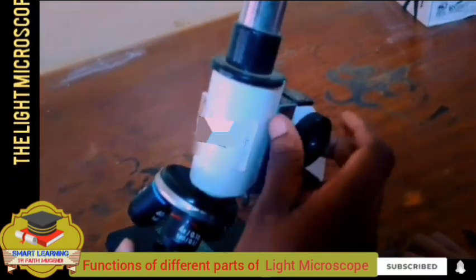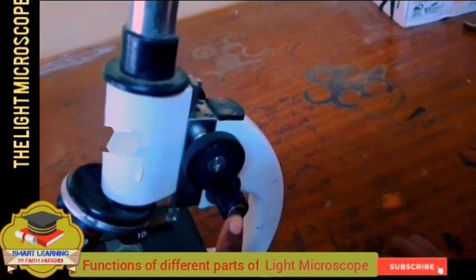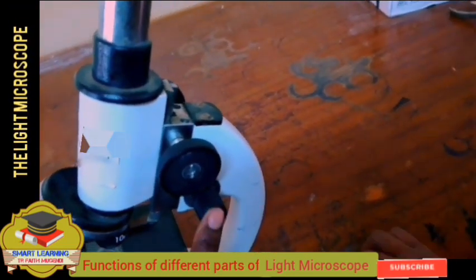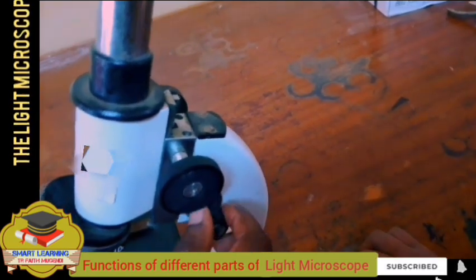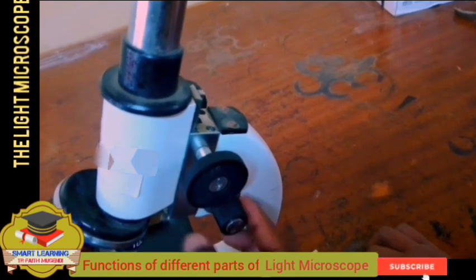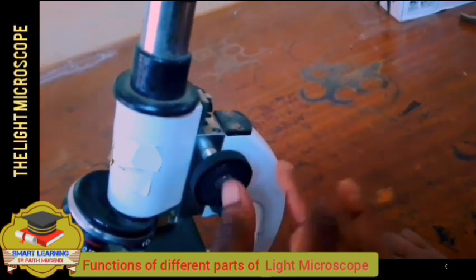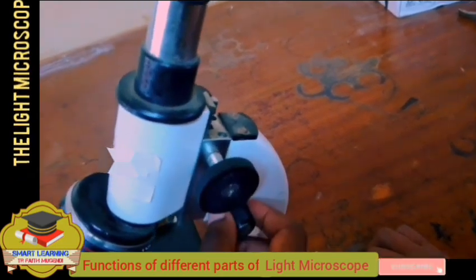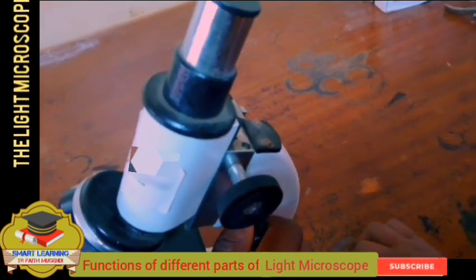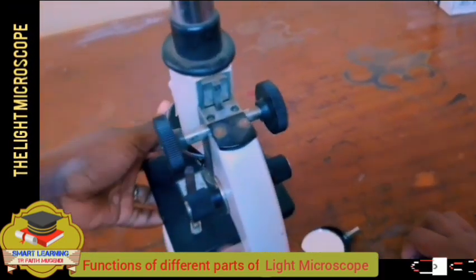Having said that, now looking at the fine adjustment knob, we have said that the body tube is moved very slightly and brings the image into sharp focus. The reason is obvious: the body tube is moved slowly, and therefore it is very easy to focus the image and bring it into sharp focus. Another thing that we can look at is the arm.